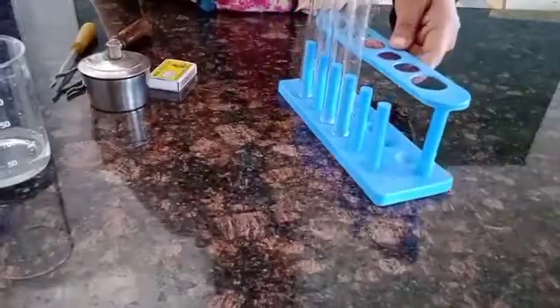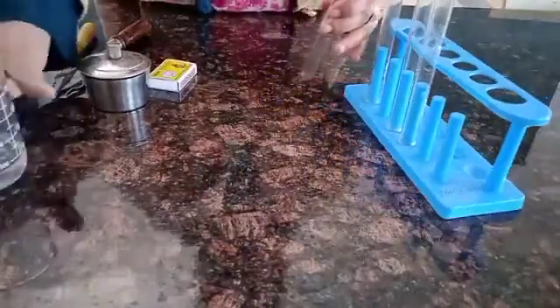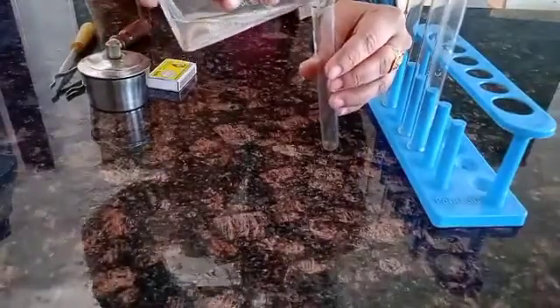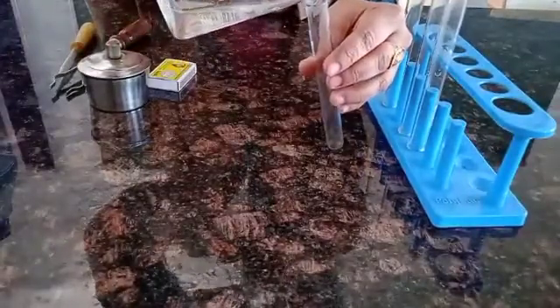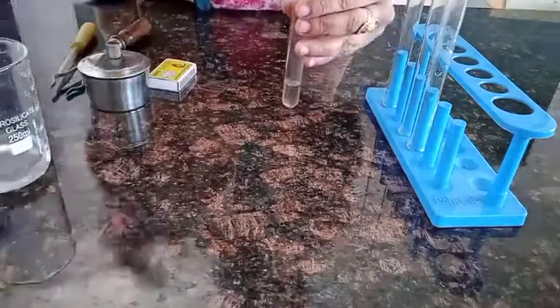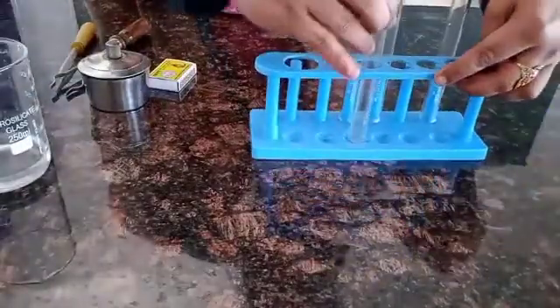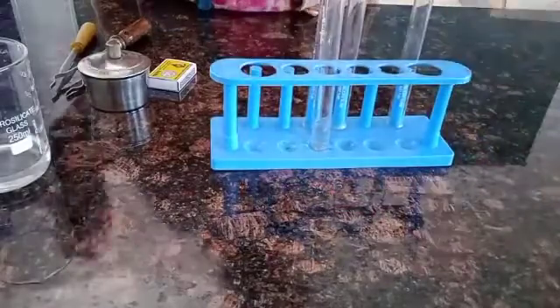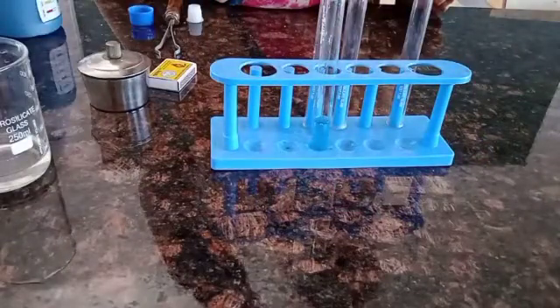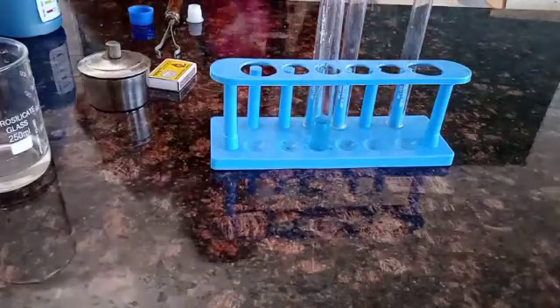First, we will take the urine sample in a test tube. We'll add 2 to 3 ml of the urine sample in the test tube. Then we'll add the Benedict solution with the help of a dropper into the test tube.